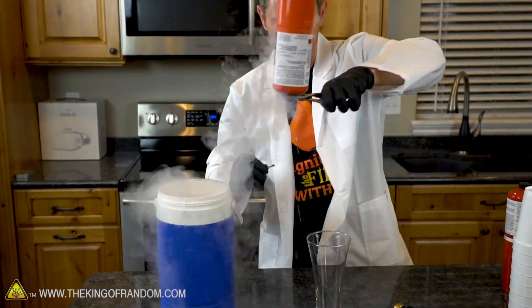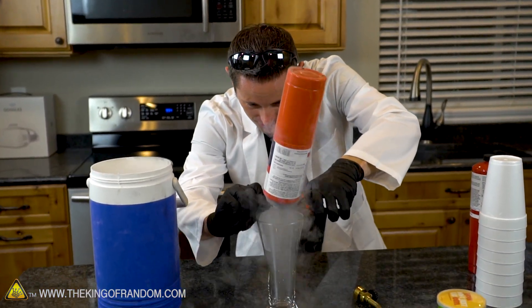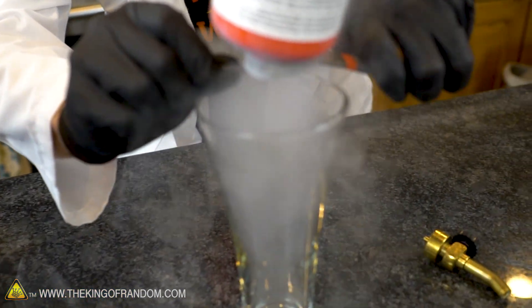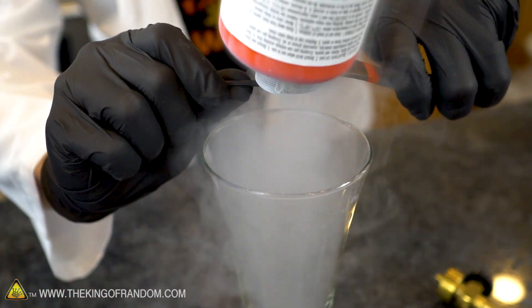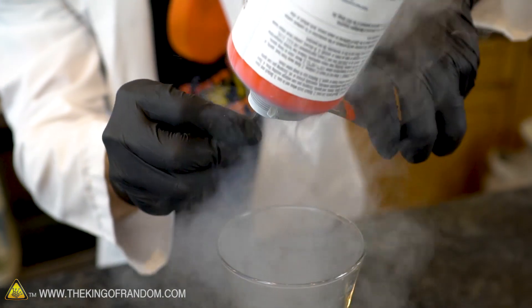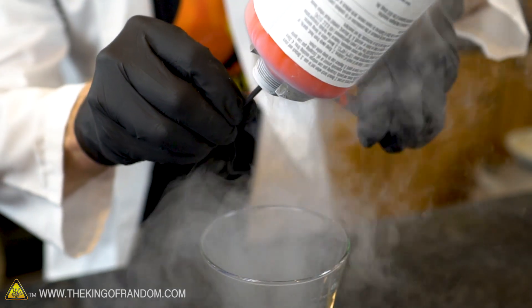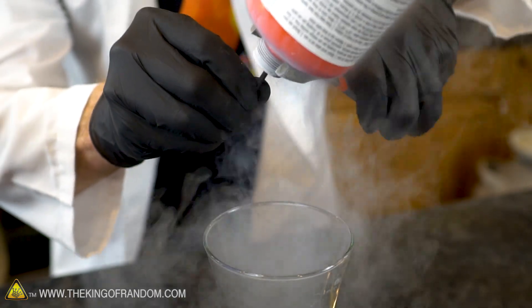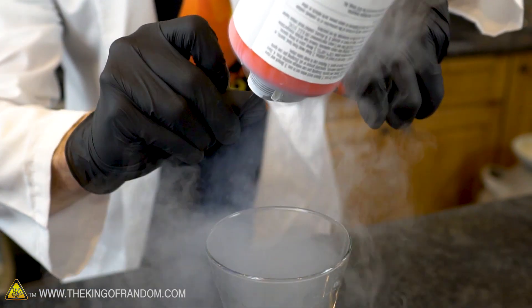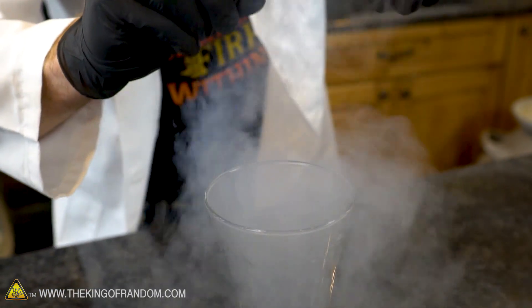That looks really cold - very very cool. Drip off the nitrogen, press the button and here's what we get. It's actually so cold right now the button is barely even releasing. I do see some liquid dropping out there - do you see that? We just have a couple little drops. Yeah, there it is, look at that!